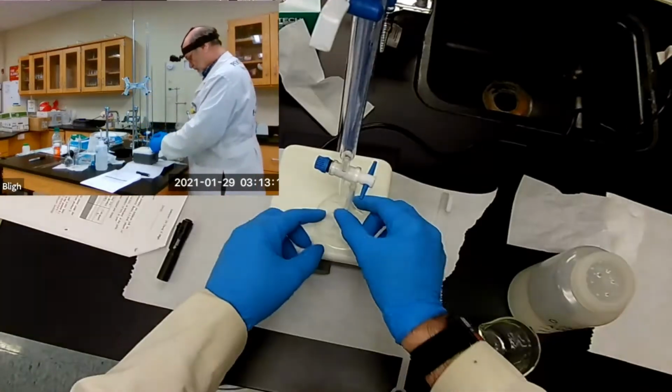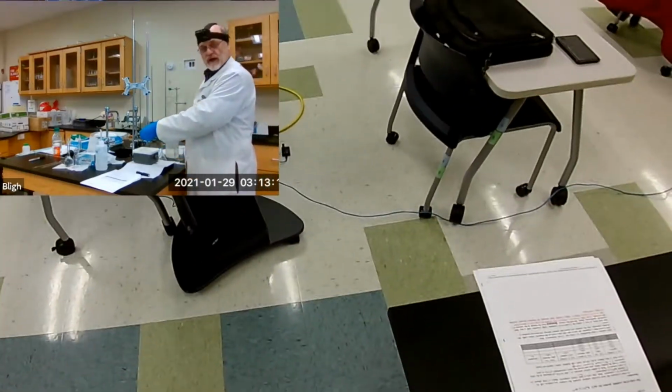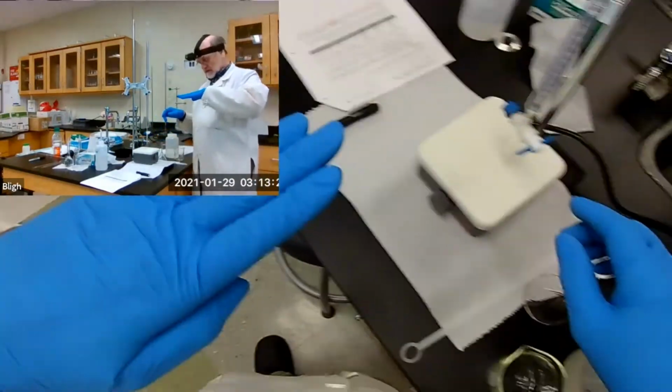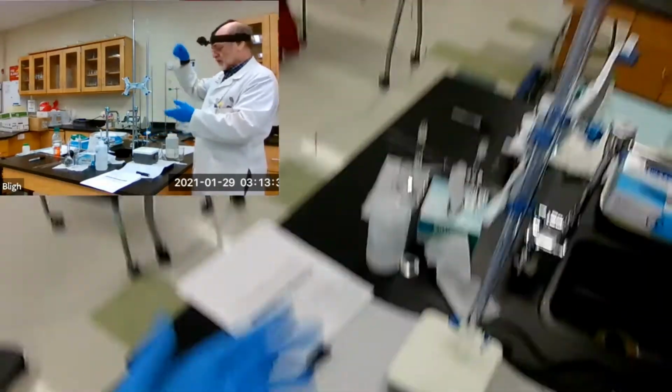Right. Remember, your burette starts off with a loosened stopcock. So you need to tighten it up, and I've already done that. And you run the handle perpendicular to the direction of the burette. That is closed, right? You don't want to turn it parallel. It's open. When you pour stuff in there, it's just going to come out on the lab bench.